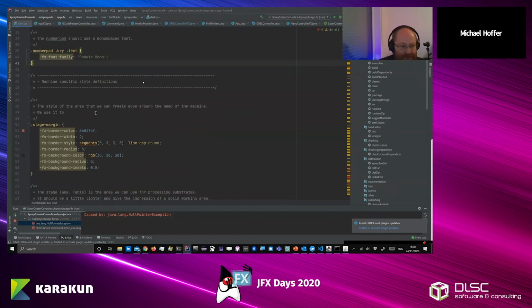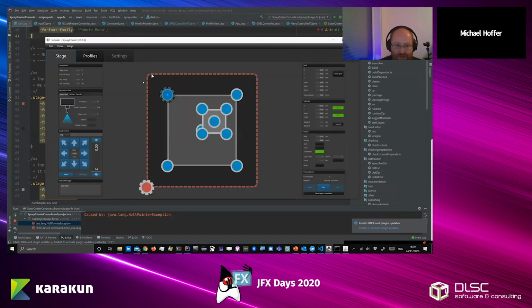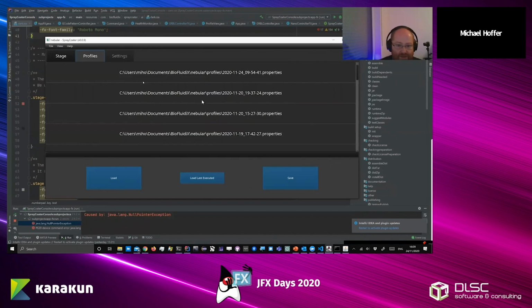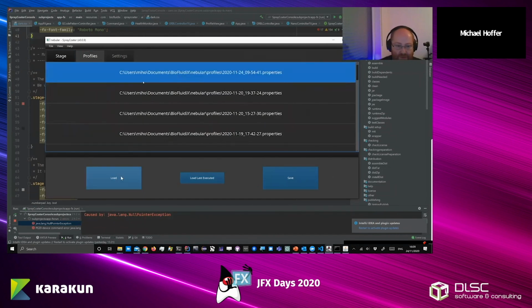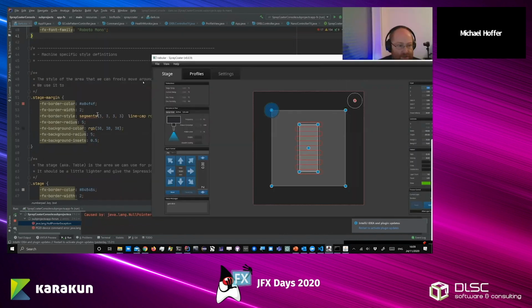And here are the things that I translated from the vector drawing program. So when you go to Inkscape or Affinity Designer or whatever, and you draw something like those rectangles. Actually, let me load a different profile, like this one. These are the colors that you see. So it's really easy to set up.